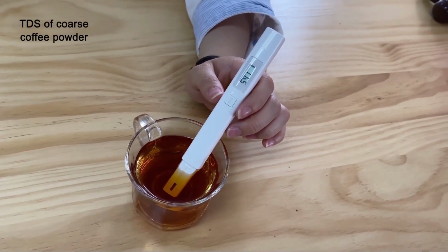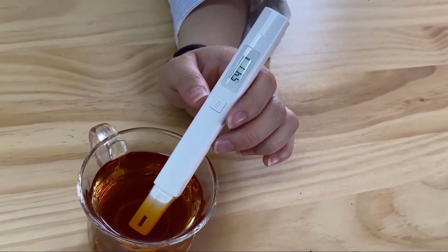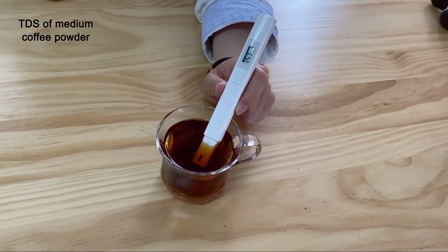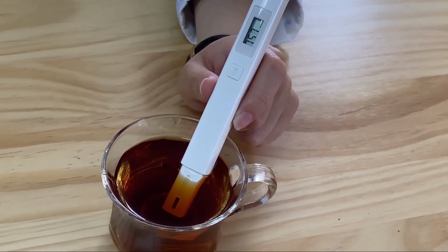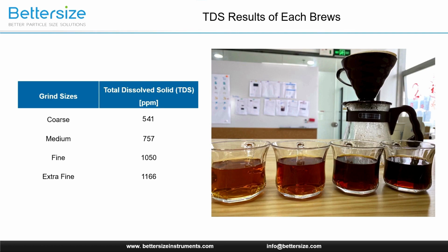To closer examine the extraction level of brewed coffee from different grinds, we measure each brew's total dissolved solid level. If the TDS number is higher, it indicates that more soluble contents in the coffee bean are extracted out in the brewed coffee. As shown in the table, TDS values increased as grinds move from the coarse to fine ends. With that being said, finer coffee grinds produce brew with higher extractions, leading to a stronger flavor.